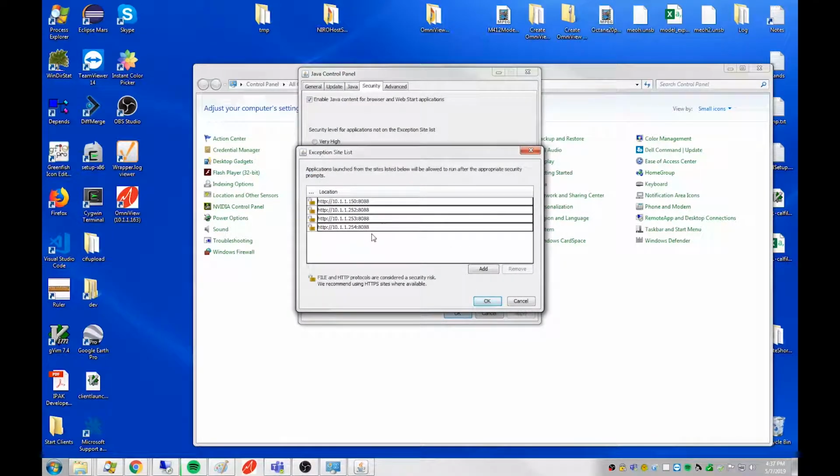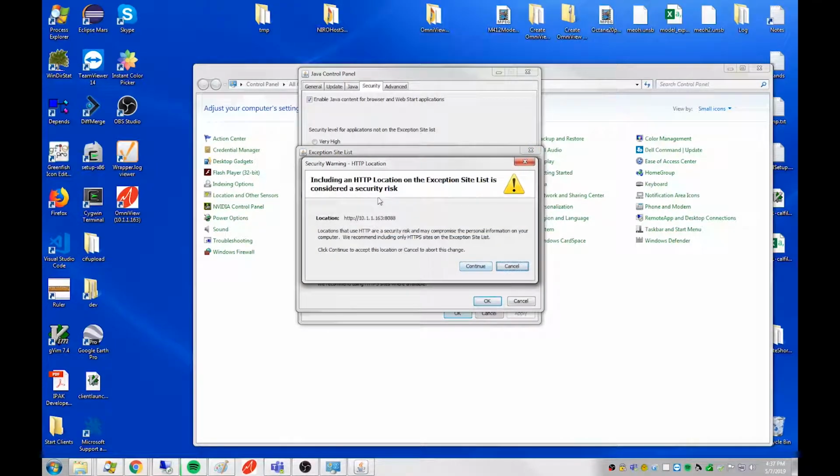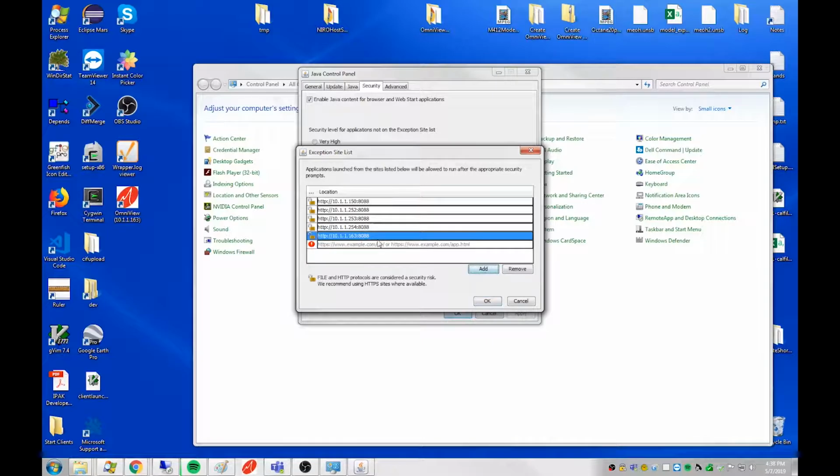We're trying to run a client from the server on 163, which is not currently in our list. So I'm going to click the Add button and put the focus in here and type http://, then the address, then a colon, and then the 8088 port that the OmniView Ignition web server uses. And then click Add again. It warns me that it's not HTTPS. It likes HTTPS, not HTTP, but the Ignition web server is not HTTPS, so this is the only choice we have. So go ahead and accept that, and now it is in our list.